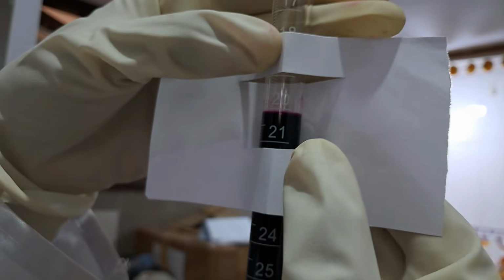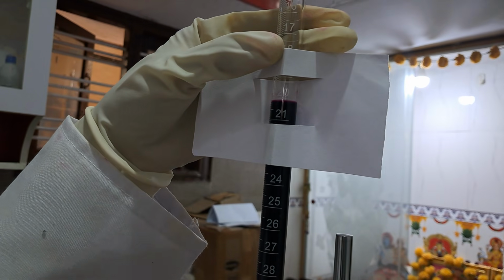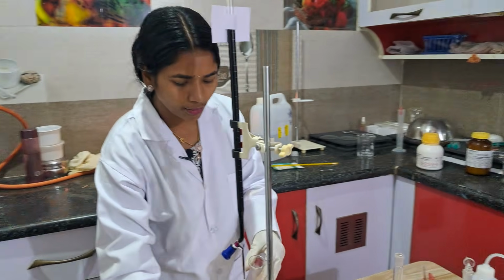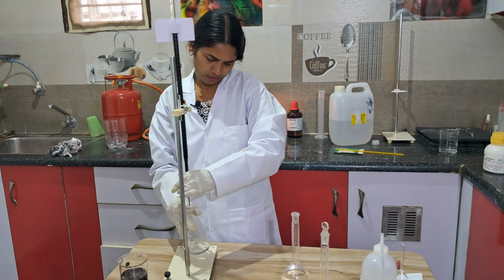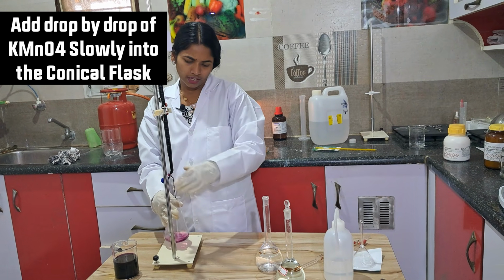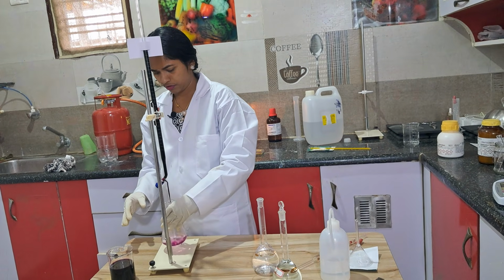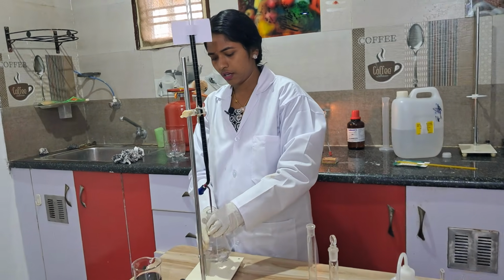Okay, we are beginning here. According to our experiment, I have made the calculation in such a way that the student has to get the reading at exactly 10 ml only. Now let's begin. Add the first drops slowly, because KMnO4 has to react with this oxalate ion.